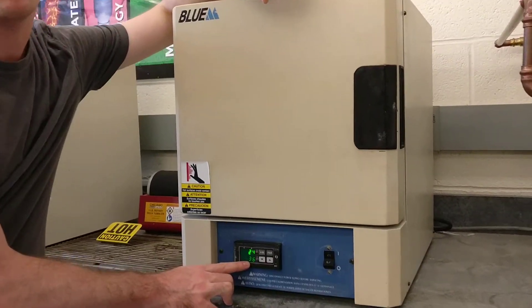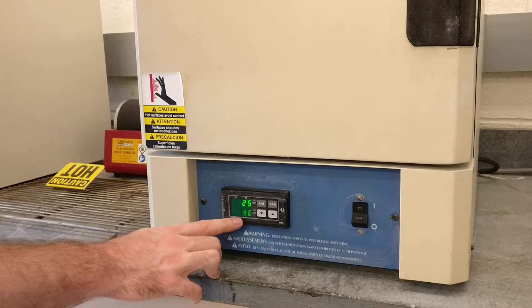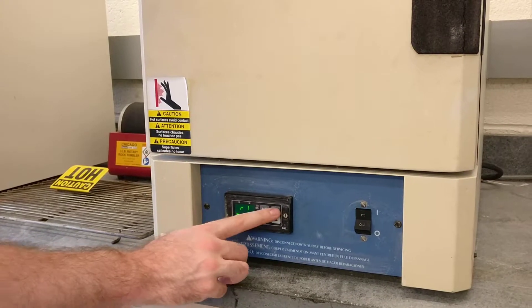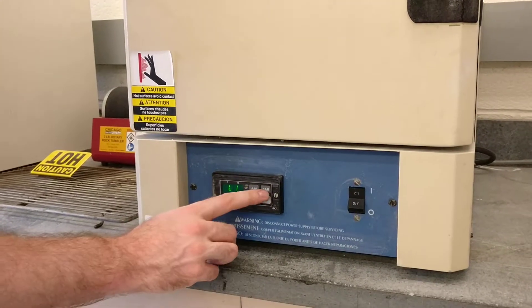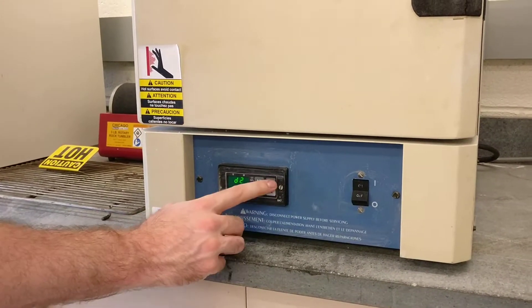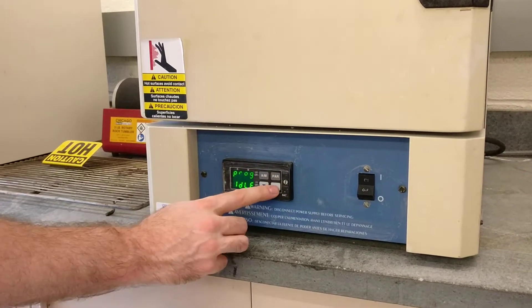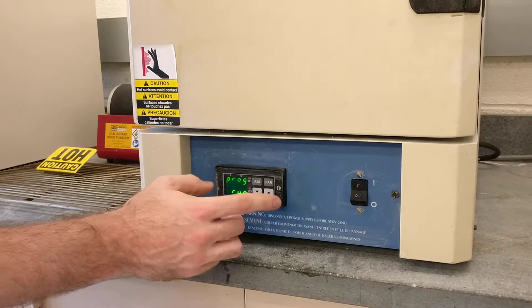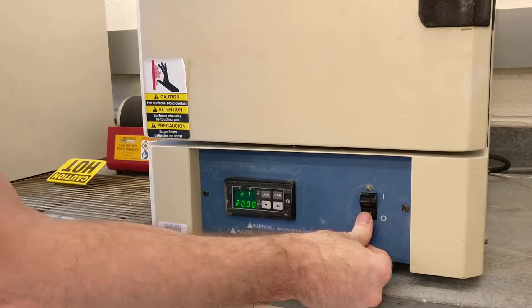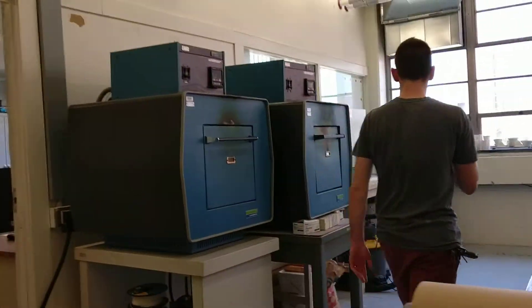After I have set that set point, then it's good. If you wanted to do multiple levels — like level 1, 2, etc. — where you go to a set point for a duration and then do a second set point for a duration, then instead of idle, you would go up to run, and then it will go through those steps. So that's that controller.